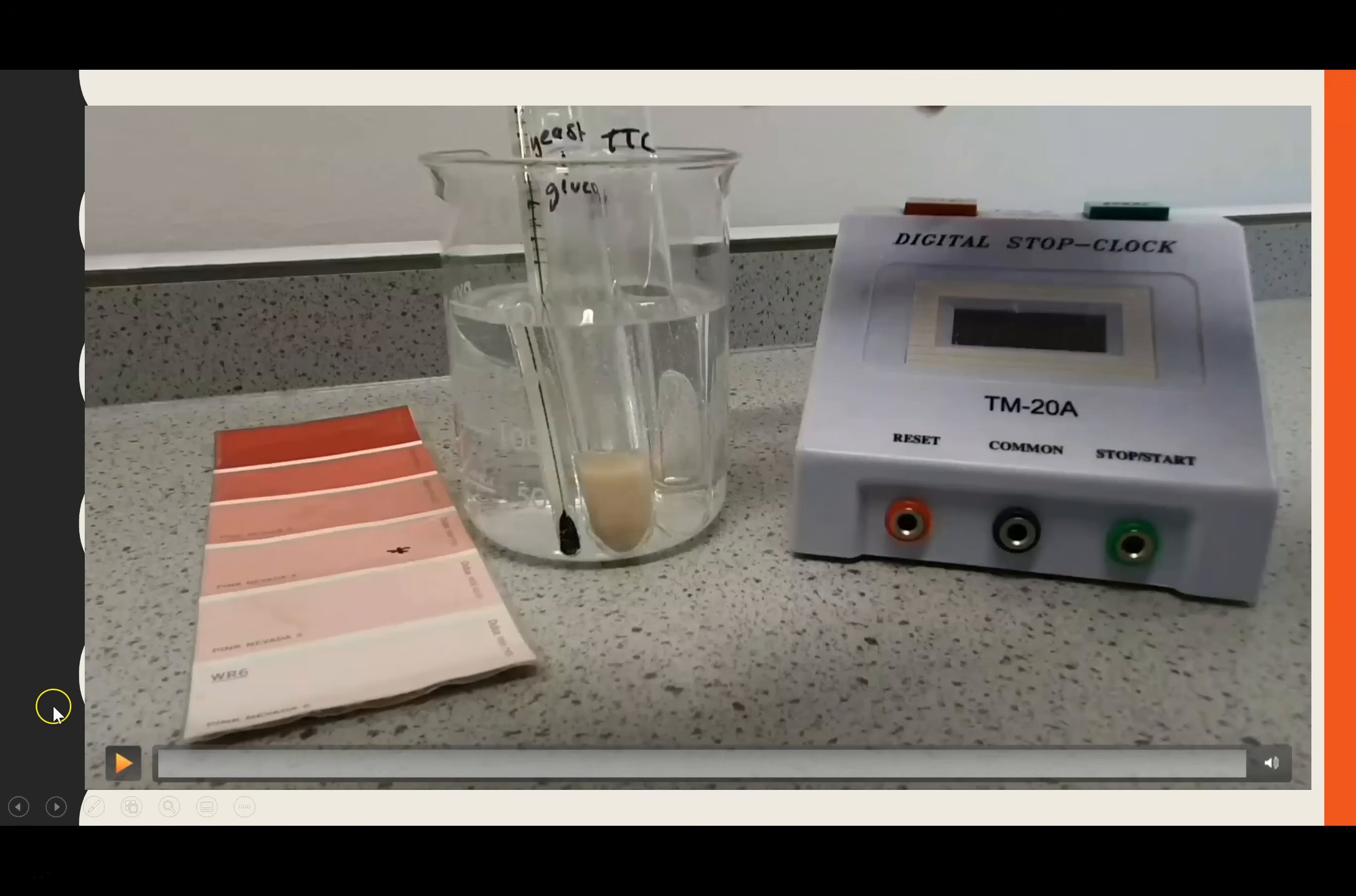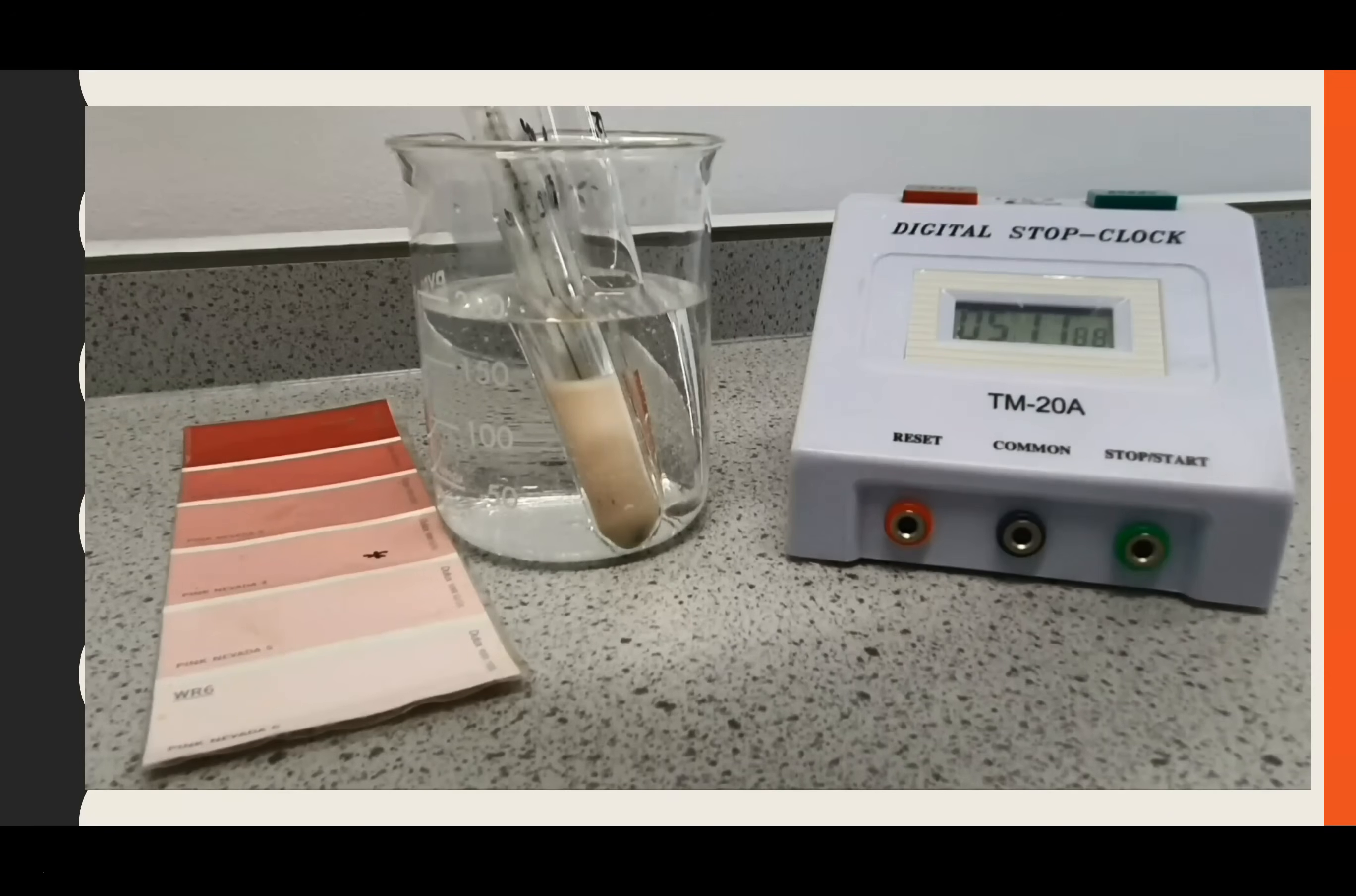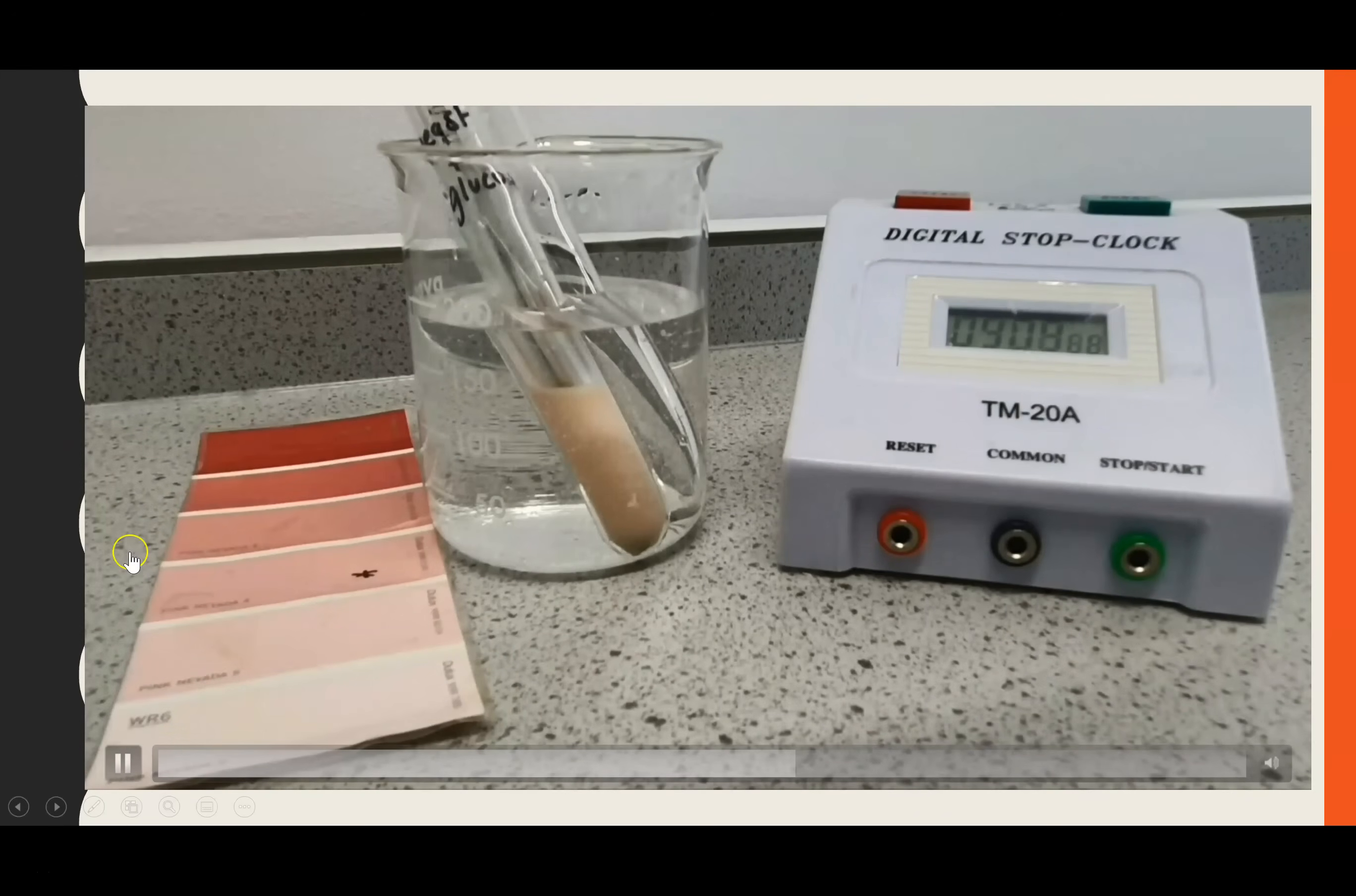Just to show you, here is the whole reaction. I've mixed together the yeast and glucose - we have to provide glucose because that is one of the substrates for respiration. The TTC is already in there. You'll notice that periodically I'm stirring it, and that's because you can see on the time lapse quite clearly that the yeast does start to settle to the bottom if you don't stir. We end up with lots of the single-celled organism yeast starting to sink towards the bottom, and the sugary solution and TTC will remain at the top. So we need to mix it so that that doesn't occur.